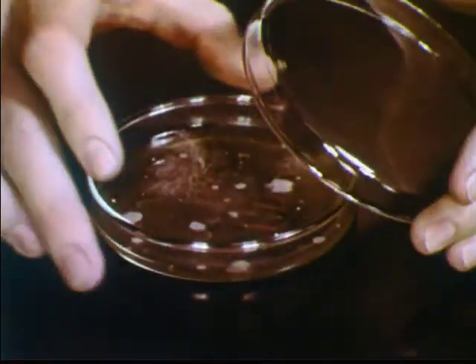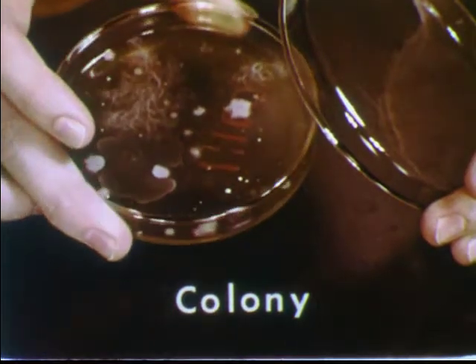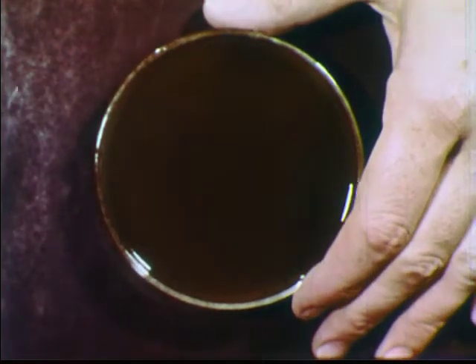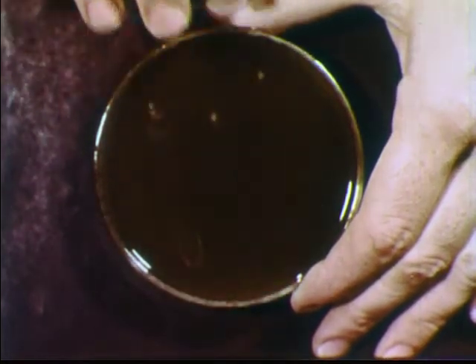Thus great numbers of cells are created in a short time. After one or two days of incubation, this tremendous mass of bacterial cells becomes visible to the unaided eye. These visible masses are known as colonies; each colony can arise from a single cell. The development of colonies can also be seen when fingers — normally carrying bacteria — are rubbed across the surface of a nutrient material. Time-lapse photography reveals the development of colonies.